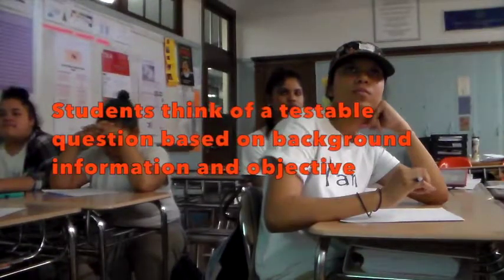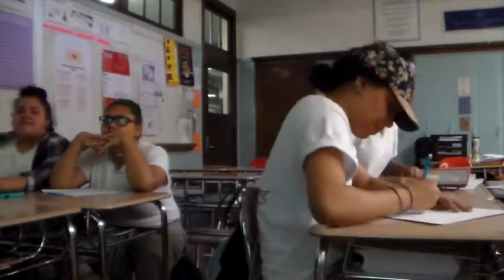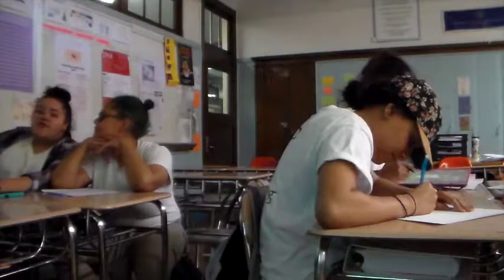We can ask ourselves and then carry out through an experiment. Okay? Talk with your group. What's a question we could test? What you said? Can we determine the concentration of acid? Yeah, like is there an acid of some sort? Yeah. Or both of them. And what made you think of that question?